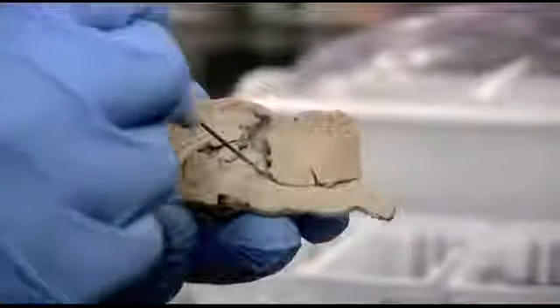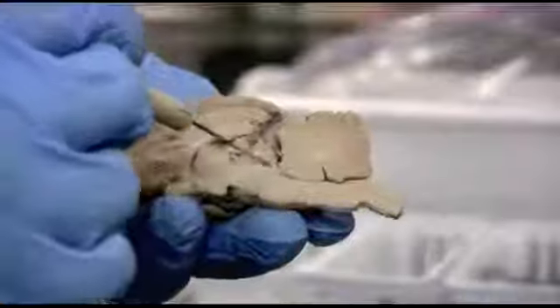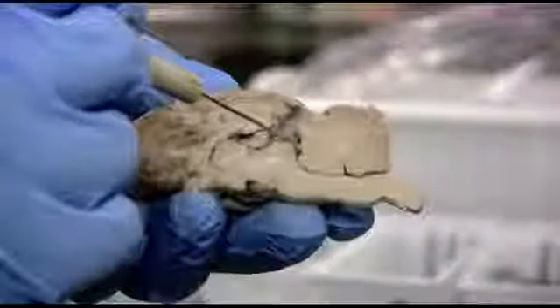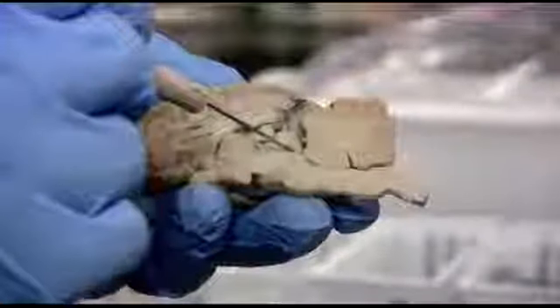The canal, as it comes up, you can see this is where those corpora quadrigemina are in this mid-sagittal view that you're looking at down the center cut. This is the superior colliculus and the inferior colliculus. That's the singular version of colliculi.